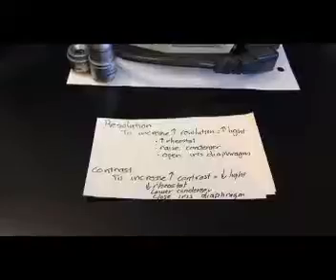Now, in contrast, when we're working with wet mounts, living microbes, most microbes have very little pigmentation. And that means if we're looking at a wet mount where they're alive, we haven't stained them, there's often little contrast between them and the surroundings. So what we want to do is increase contrast, the difference between the microbe and the surroundings. And to increase contrast, we're going to do the opposite. We're going to make different changes to our microscope.